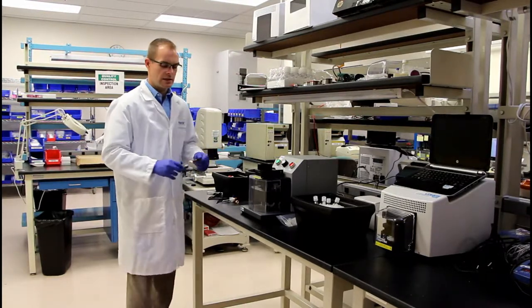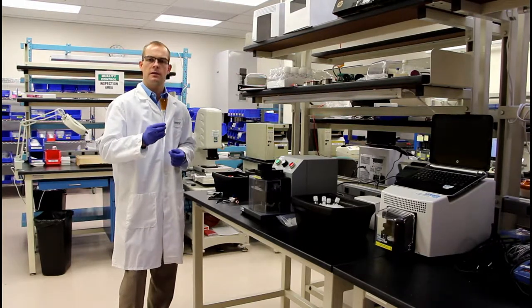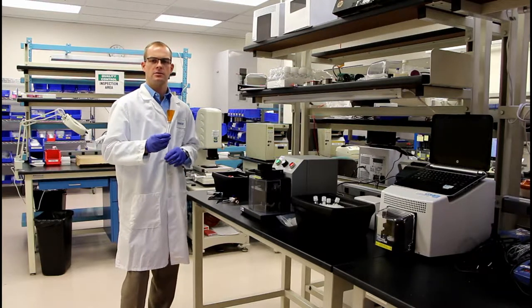What we'll be using today is the TT01 tissue bag and cryo vial. Essentially this is made for up to about one gram.